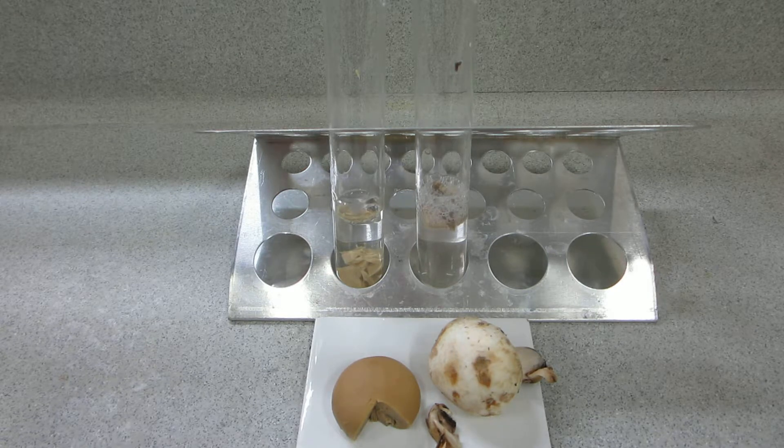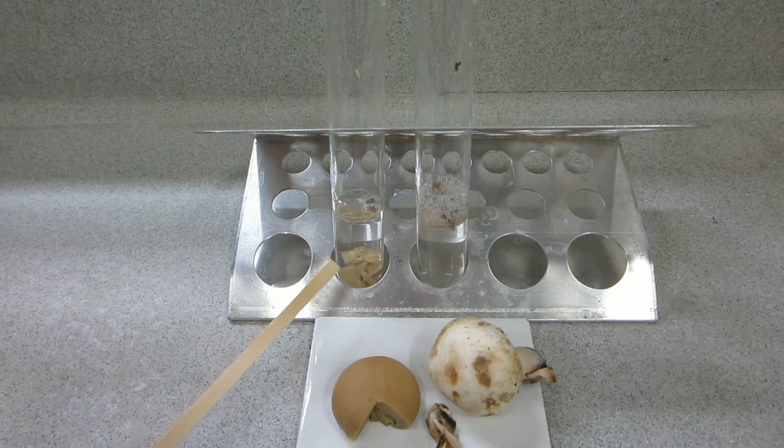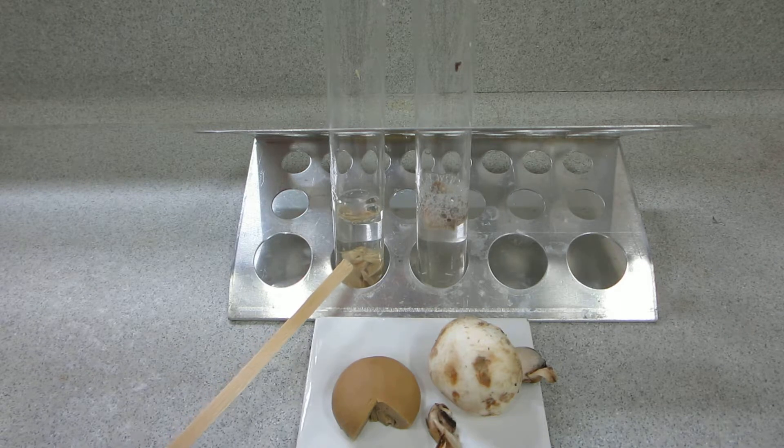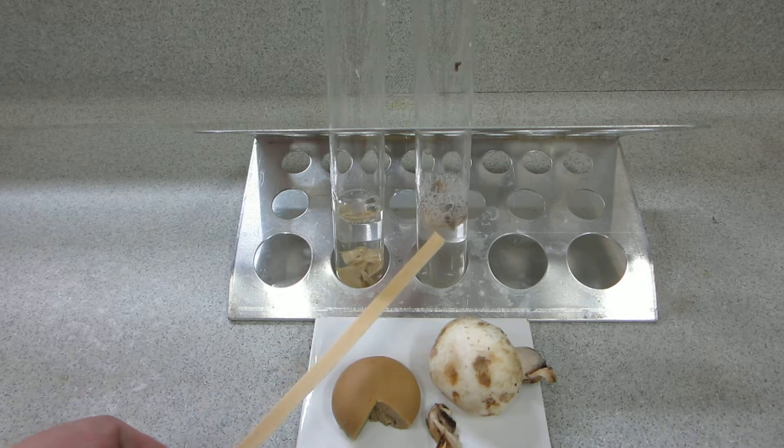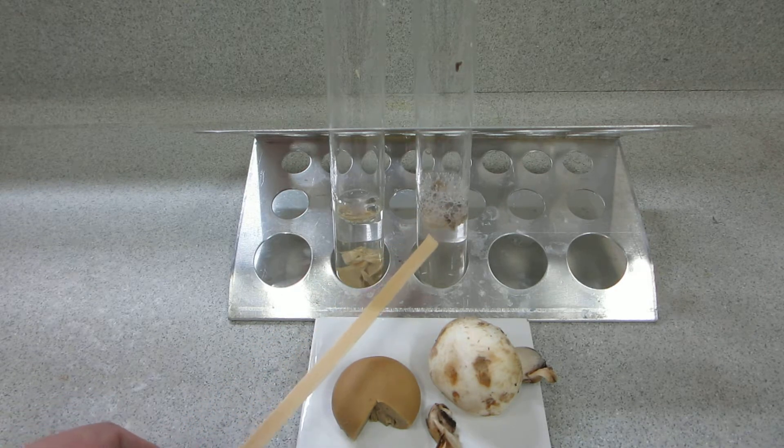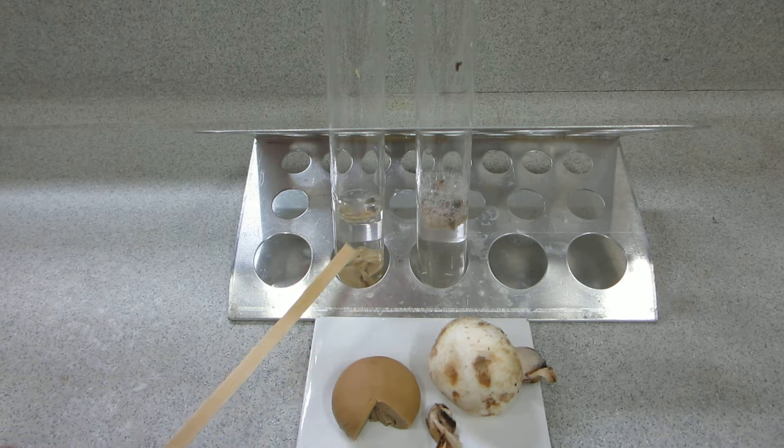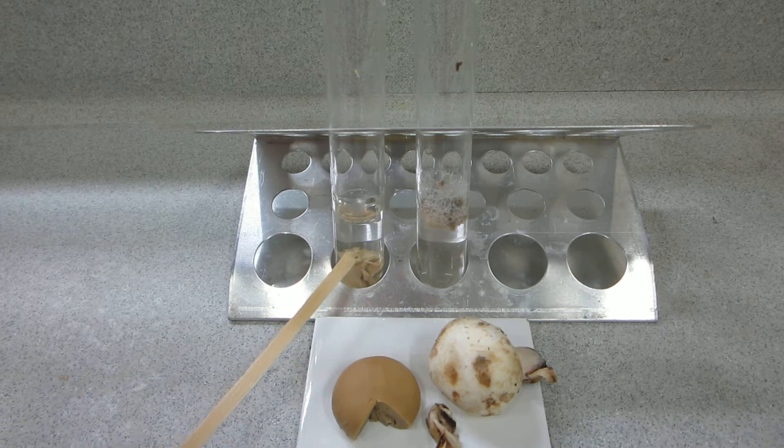So you can see a noticeable difference in the evolution of gas, oxygen gas we hope, from here the live mushroom and none at all here in the canned mushroom.